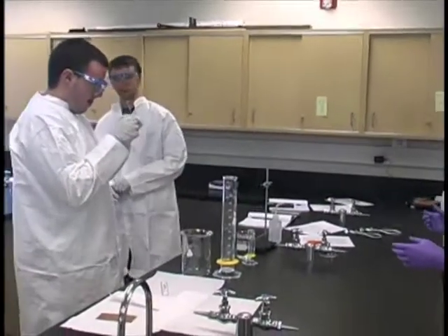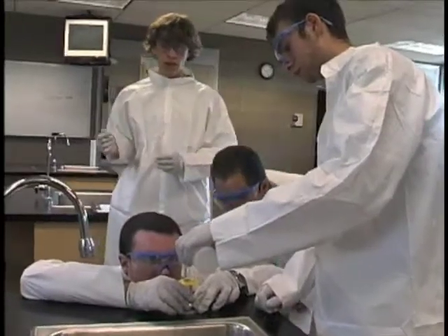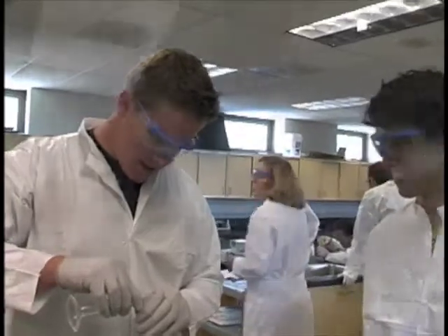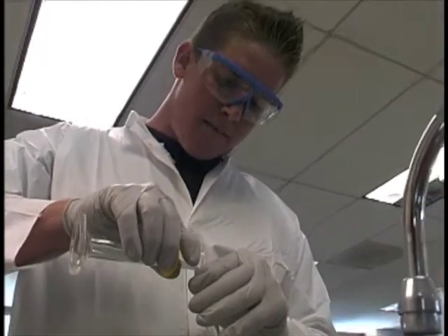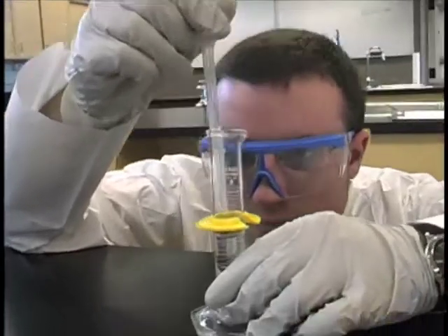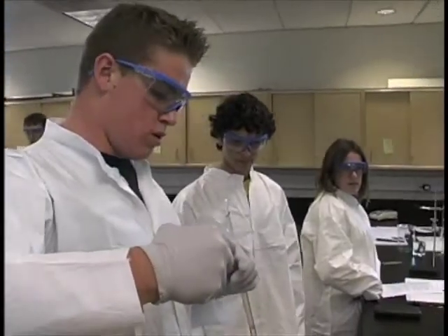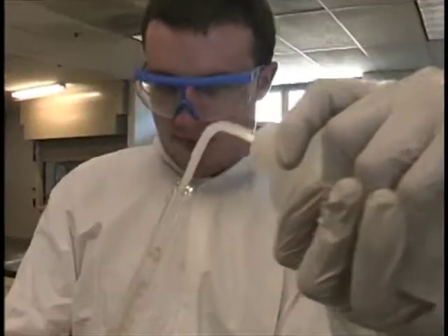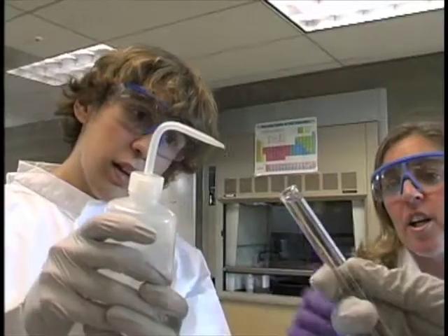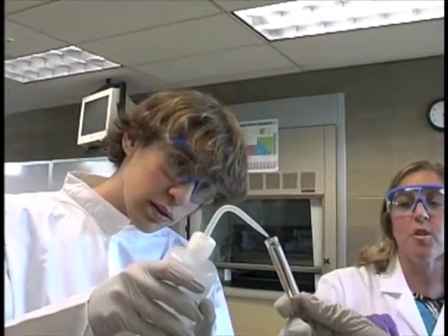You need 25 mils of hydrochloric acid, which is behind Mr. Krause. He has the steadiest hand of all. Fill it all the way up so that there's no air bubbles at the top. You don't want it to mix — no air at all. You can tilt it up more, tilt it all the way up so it's straight right now.